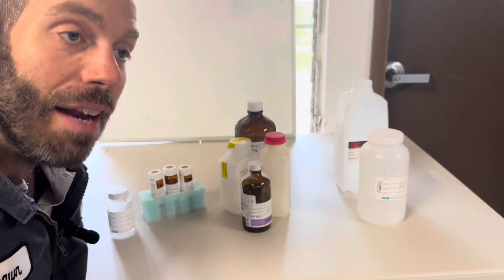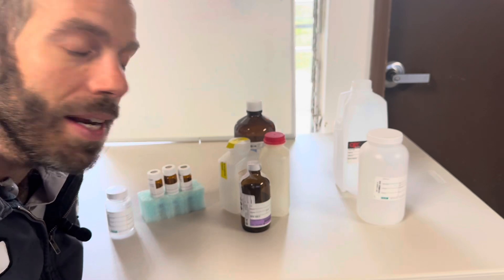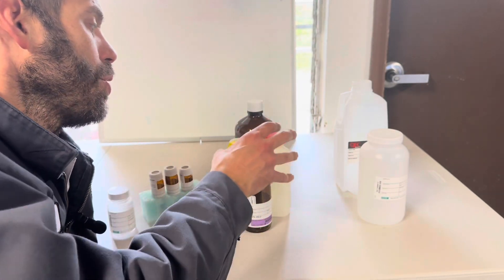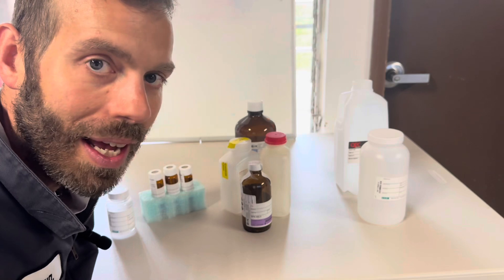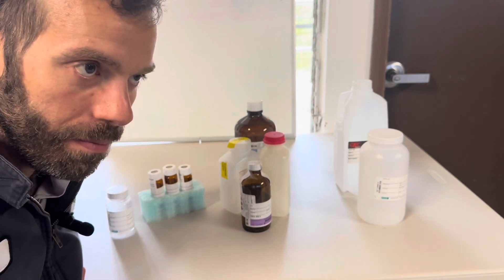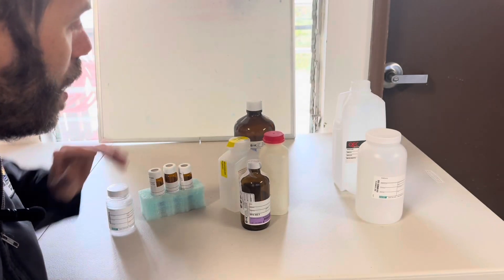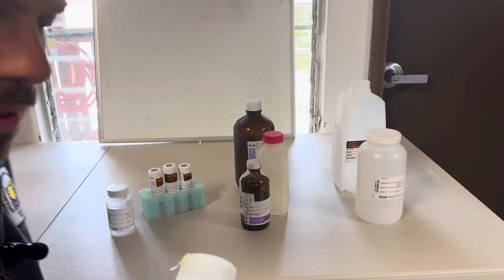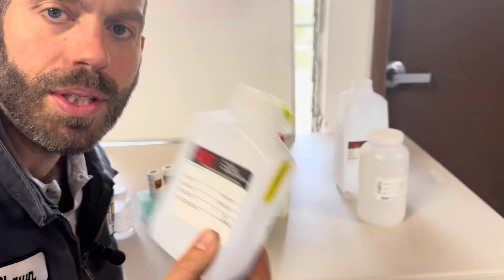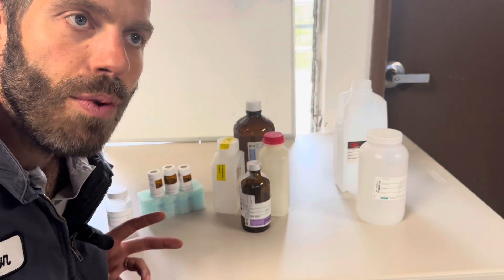Know what 'fixing' a sample means — it typically means it's acidified. You're usually adding acid to lower the pH to sequester what you're trying to look for, and that helps with hold times. That's why you fix a sample — so it stays intact on the way to the lab. I've got nitric acid here for metals, hydrochloric acid for oil and grease, and sulfuric acid for ammonia. But notice — that bottle has a broken custody seal. I'm not using it; it came like that from the lab.